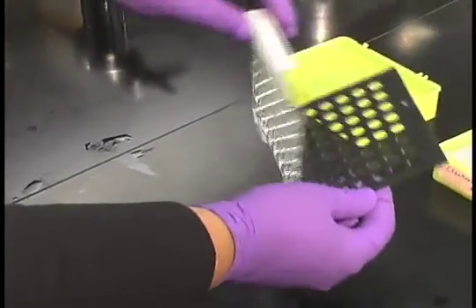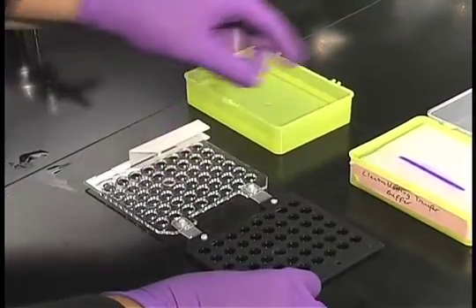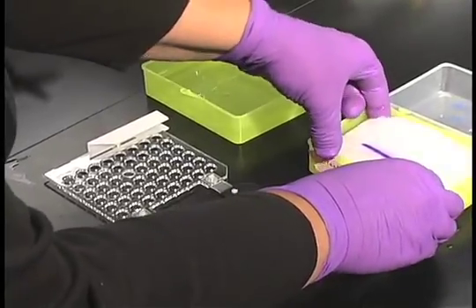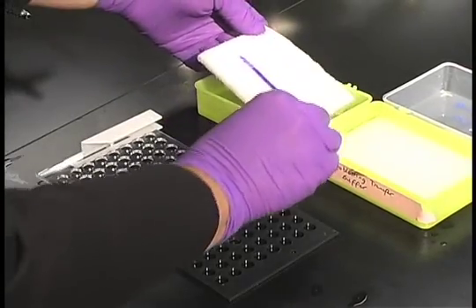We're done with the methanol now so we'll exchange that for some more electroblotting buffer. This is a cartridge that will assemble our electroblotting devices in. The gel, we'll remove that for now, put it in another container of buffer.